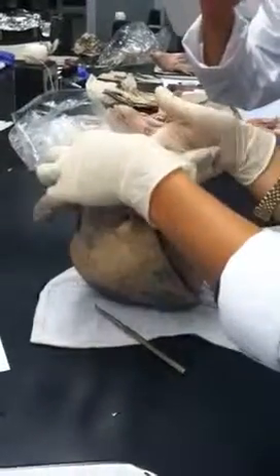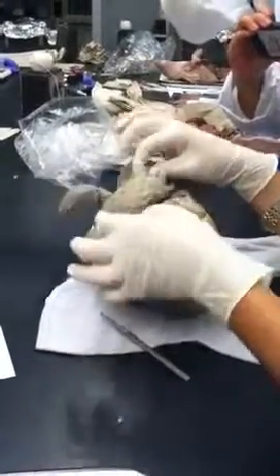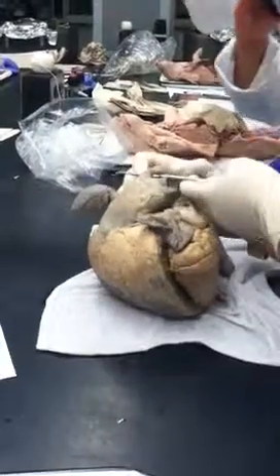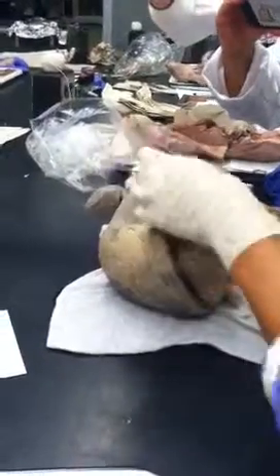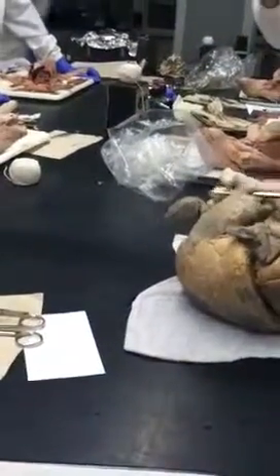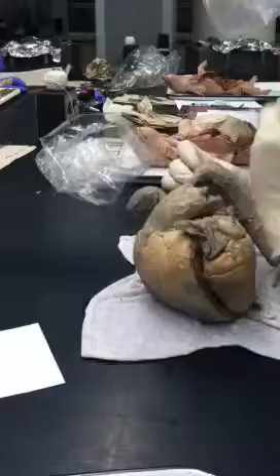If you squeeze this, you can feel there's no space in there. It's literally just a ligament. If we asked you to identify that, we would put something underneath it to make it clear what we're pointing to. Does that connect to the aorta? Yeah, exactly. That's where it would have been. This is the arch of the aorta right here. So let's continue with our trace. But yeah, this is the ligamentum arteriosus.